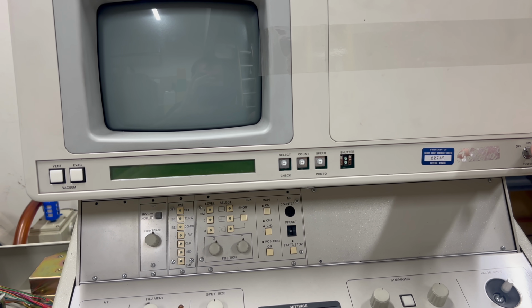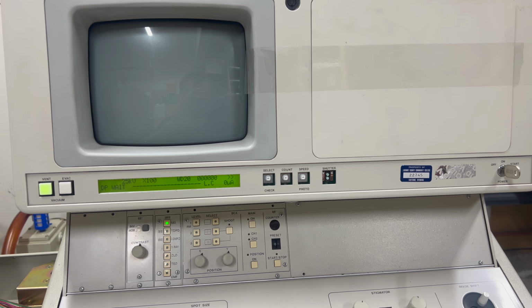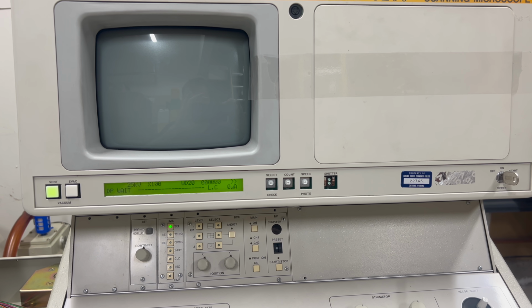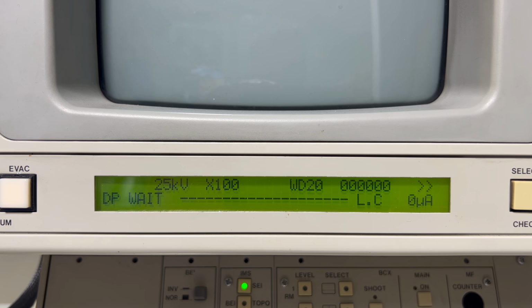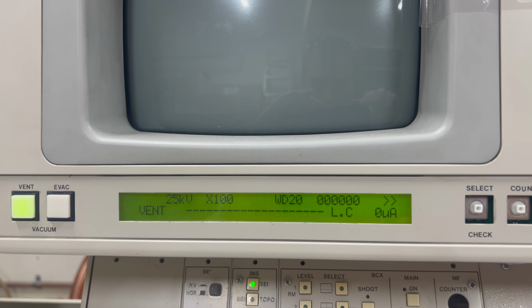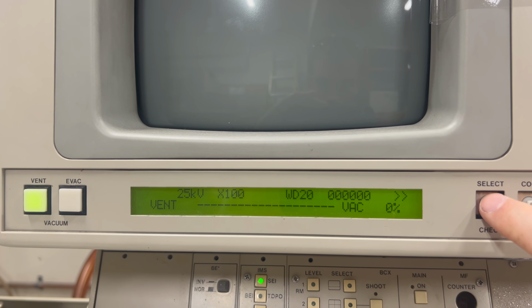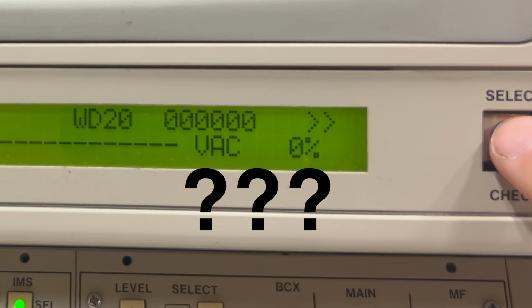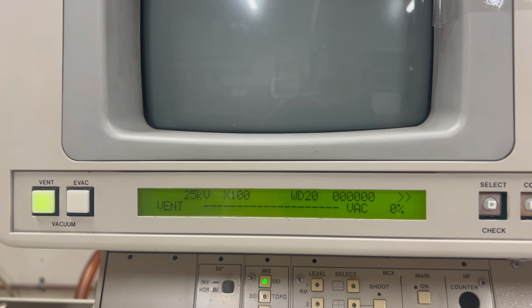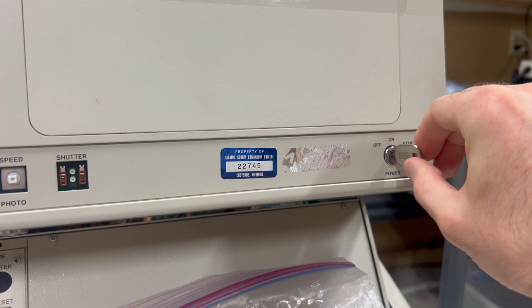Let's see if we've made any progress. Hey! Much better. It looks like the digital logic is at least somewhat working now. This LCD displays some useful diagnostic info about the machine, such as the operating current of various components, as well as the current vacuum levels, though the vacuum level is in percent rather than an actual pressure unit like torr. Weird. Now that the electrical power seems like it's working, it's time to test the vacuum system.